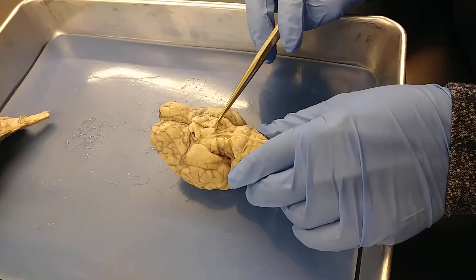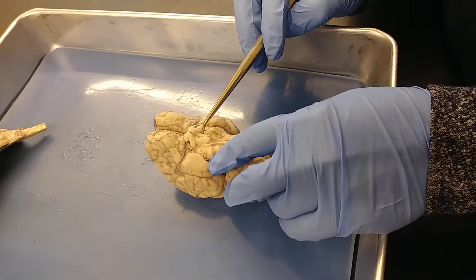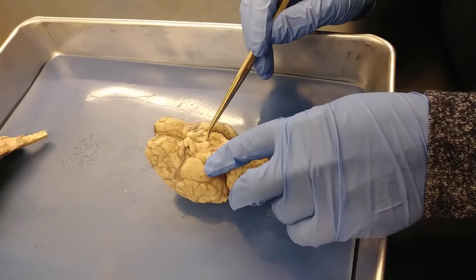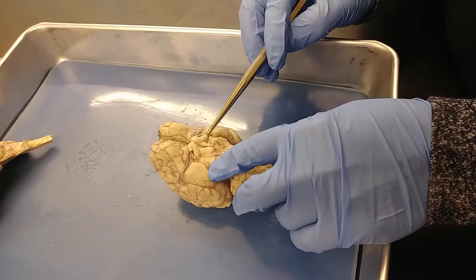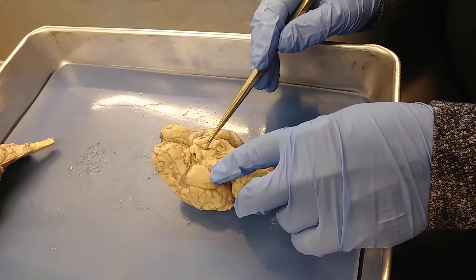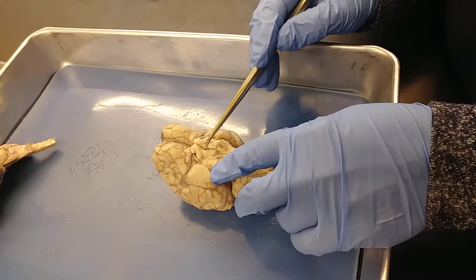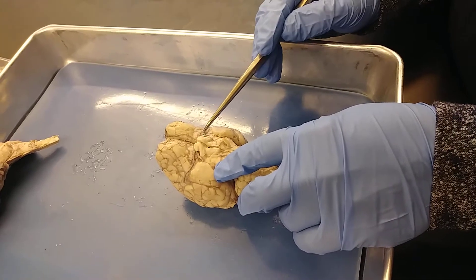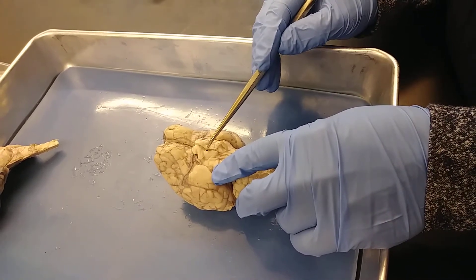Right here is called the mammillary body. Sometimes it's even considered like an extension of the hypothalamus, so it's part of the diencephalon. This hole right here is where the infundibulum would hang if the animal were alive. And then a ball-shaped gland called the pituitary gland would hang off the bottom of the brain here.